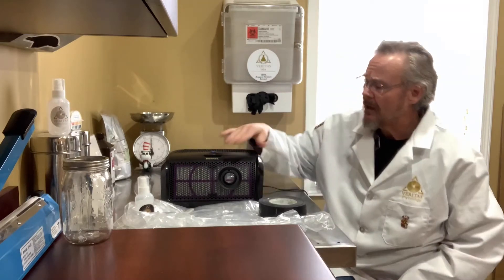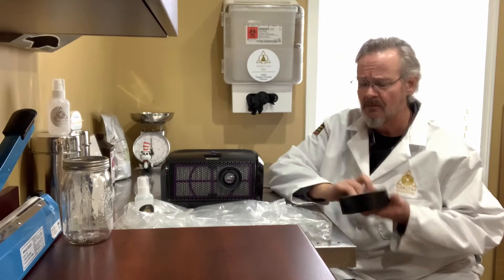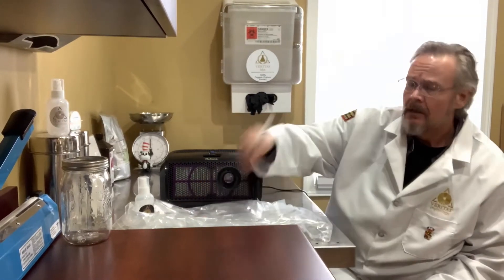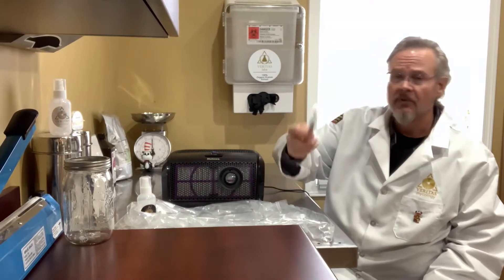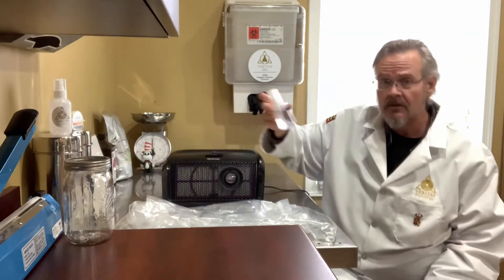This thing here will serve you well if you decide to do it. It requires this unit and the Filtrete filter that's in there, so you've got about 60 bucks in that. A row of gaffer's tape or good duct tape, and a cutting blade that's extra sharp — I'm using a disposable scalpel, but a razor blade works too. Just make sure it's very sharp.